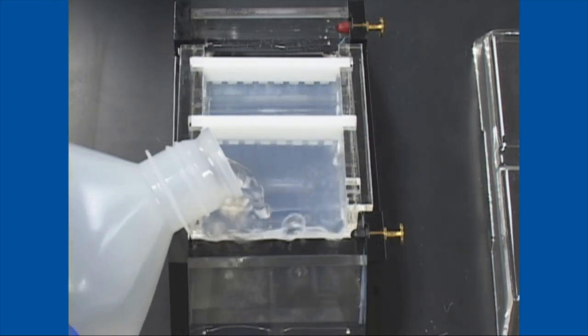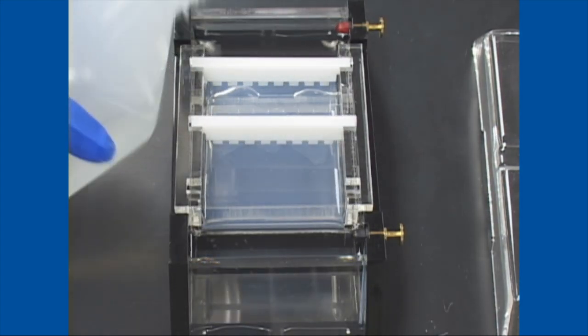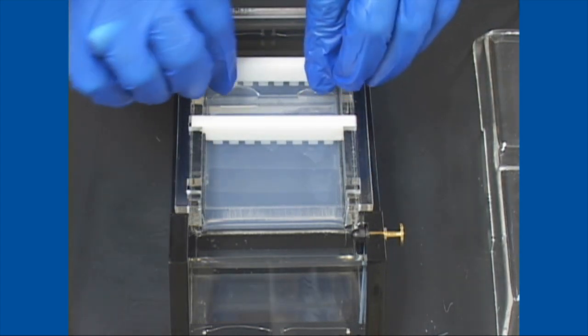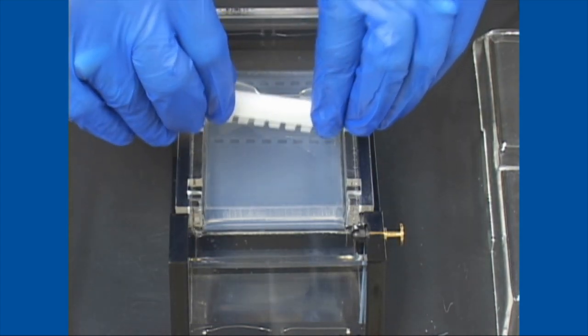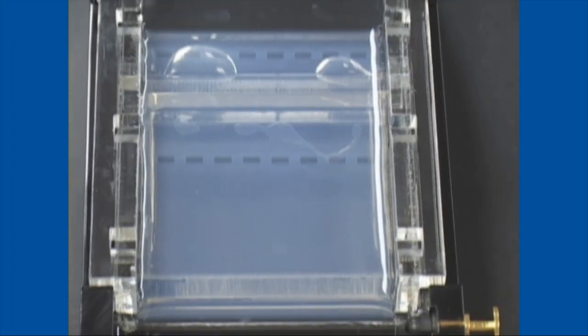It is important that these are diluted properly. Otherwise your DNA will dissolve into the aqueous buffer versus dropping into the well. That's the importance of the glycerol or the weighting agent.